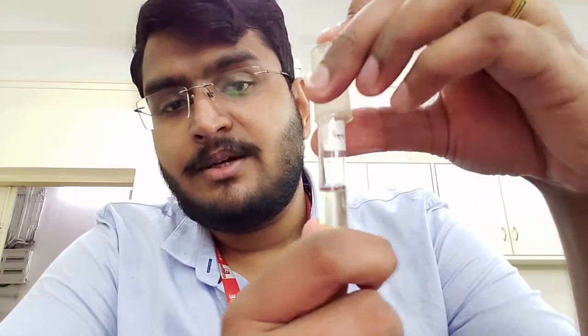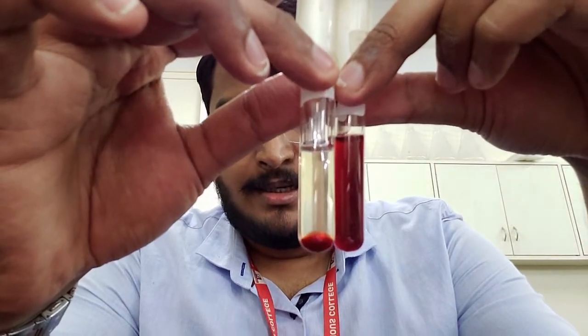Looking at the control tube, you can clearly see the cells have settled to the bottom as a button while the suspension above is completely clear — a clear indication that hemolysis has not taken place. In comparison, the tube of the alpha-hemolytic strain shows the entire solution has turned red, indicating hemolysis is occurring, though it is difficult to differentiate alpha from beta hemolysis in a tube test.